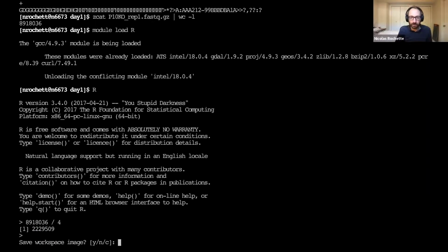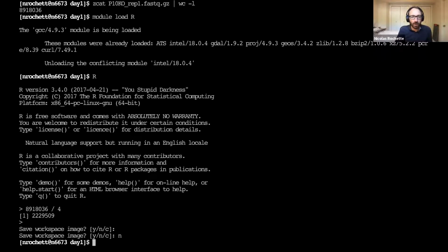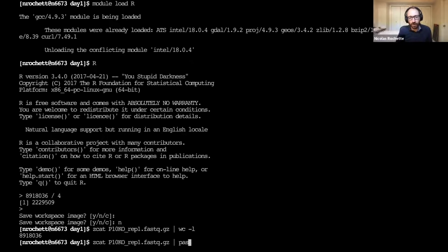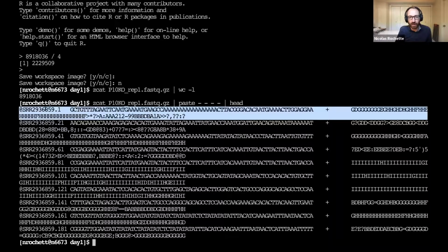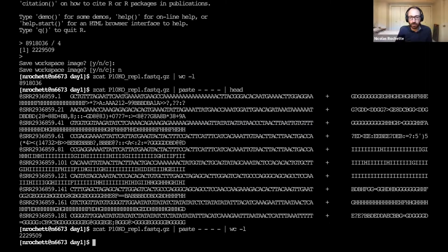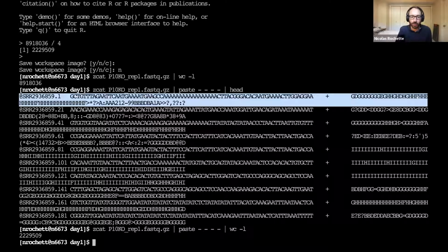Anyway, open a calculator. Another way we can do it is, so this is just the counting of lines. But as I mentioned before, we have this sort of magic command for FASTQ files that lets us put one read per line, where we have read 1, read 2, read 3, read 4, etc. And what this means is that if we count the lines now, we're actually counting the number of reads right away. Unix just likes to work with lines and columns and tab delimited columns. Not everything, but a lot of Unix tools are made for that. So when you can have your data in that format, then everything becomes a lot easier to do.